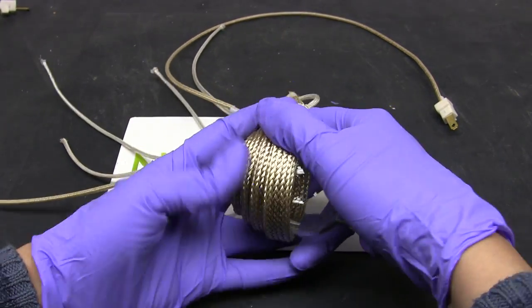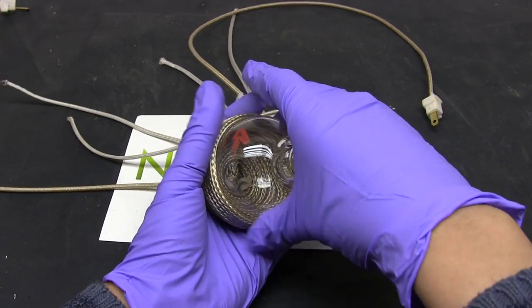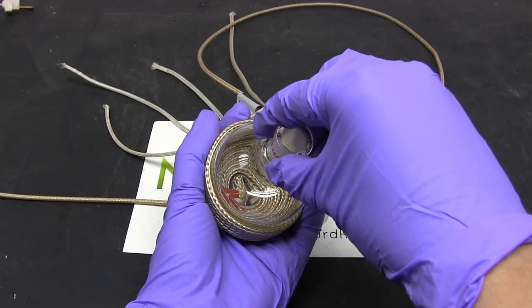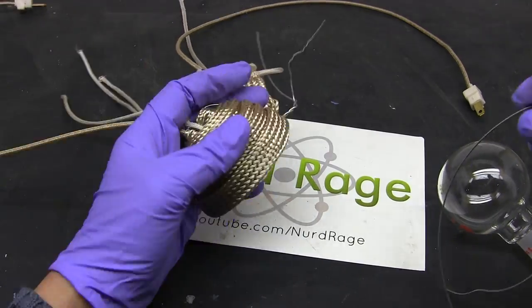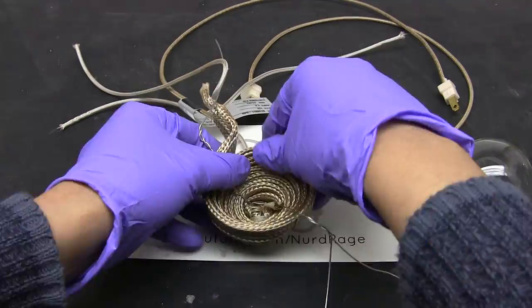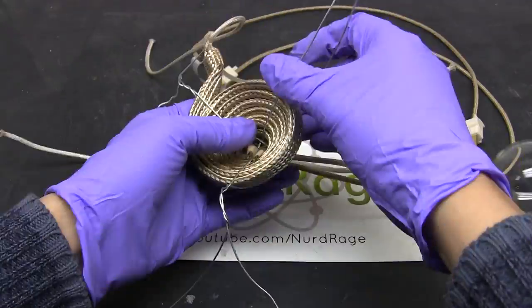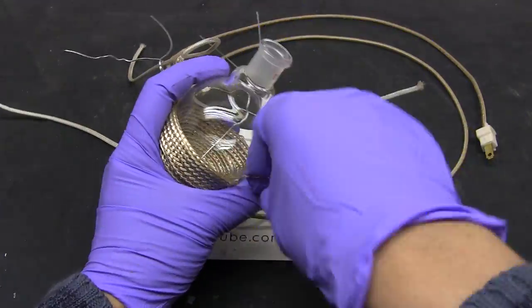If you're using a larger flask you'll need to loosen the tape instead. Once you have the shape, use iron wires to hold the shape together. Re-adjust against the flask if necessary.